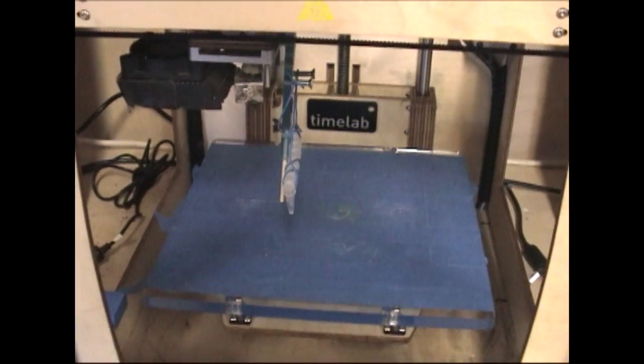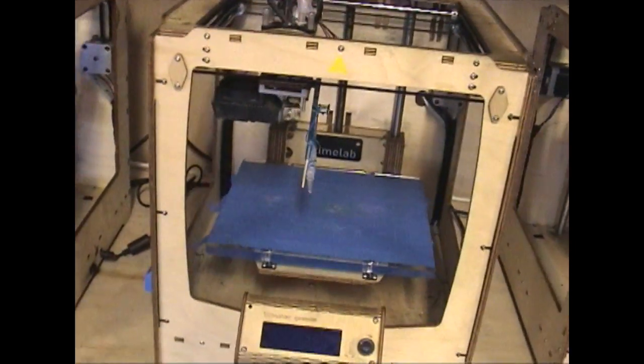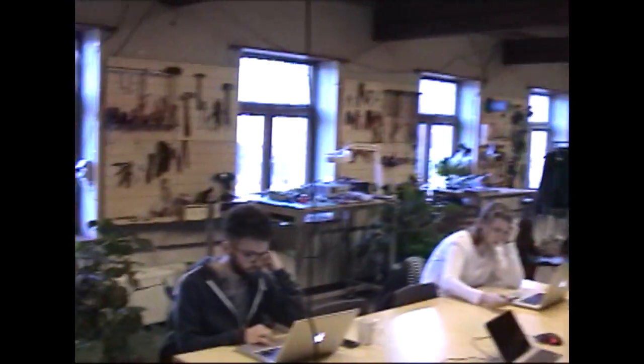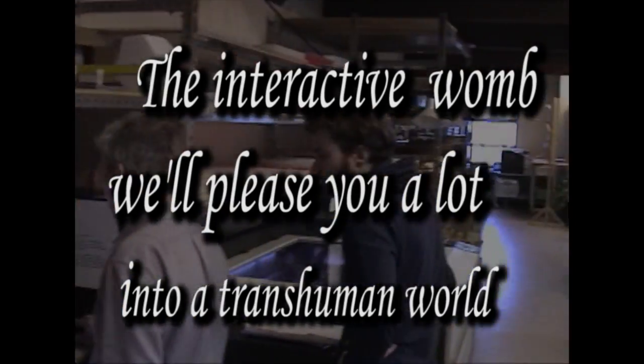It's manual, it's more interesting, gives more connection with the process. Well, there is fun all around.